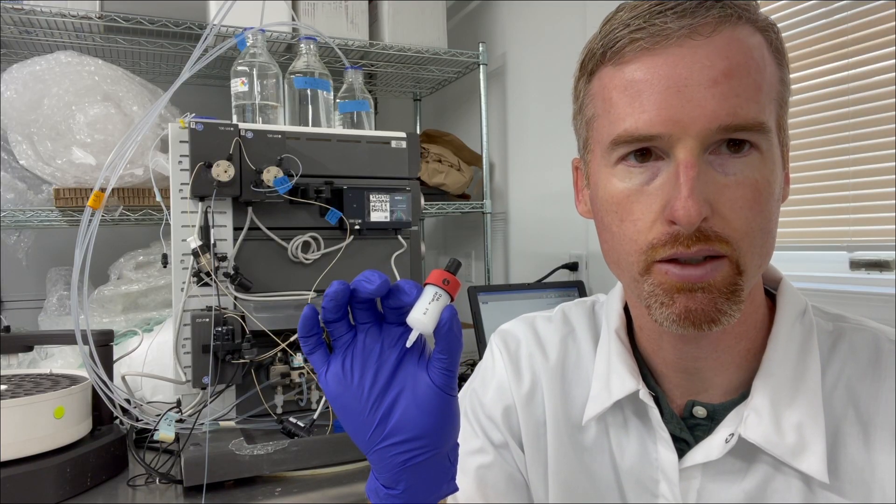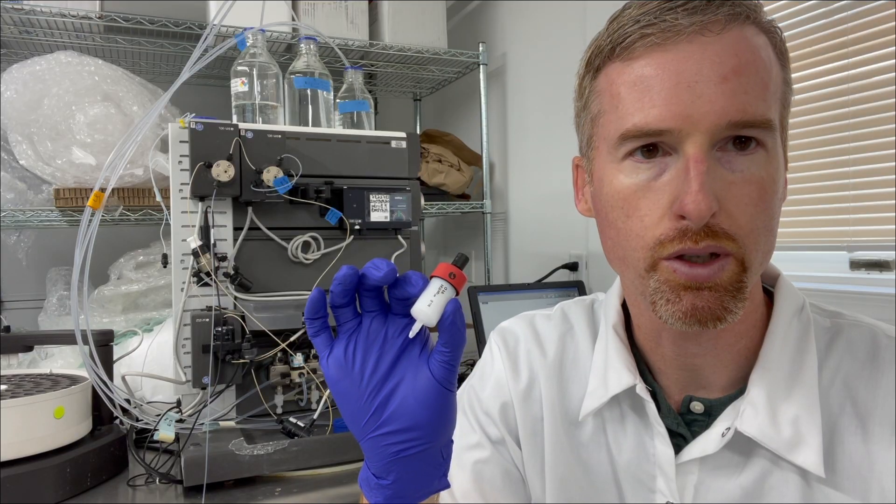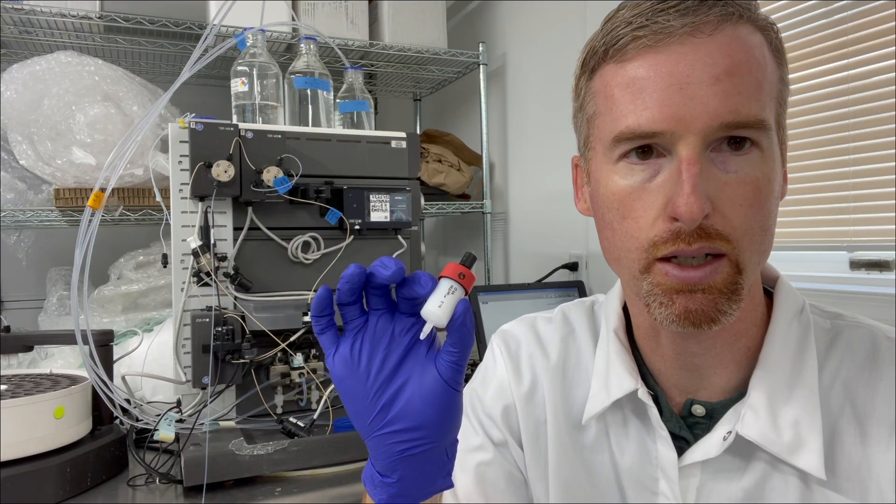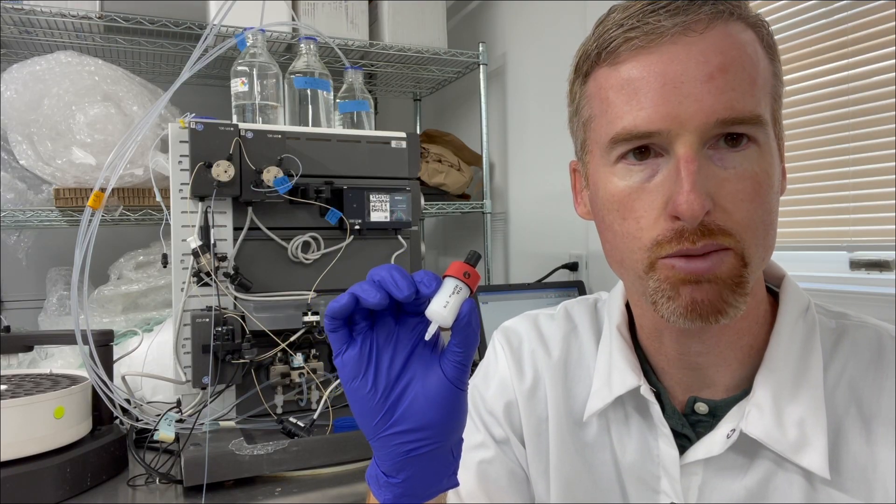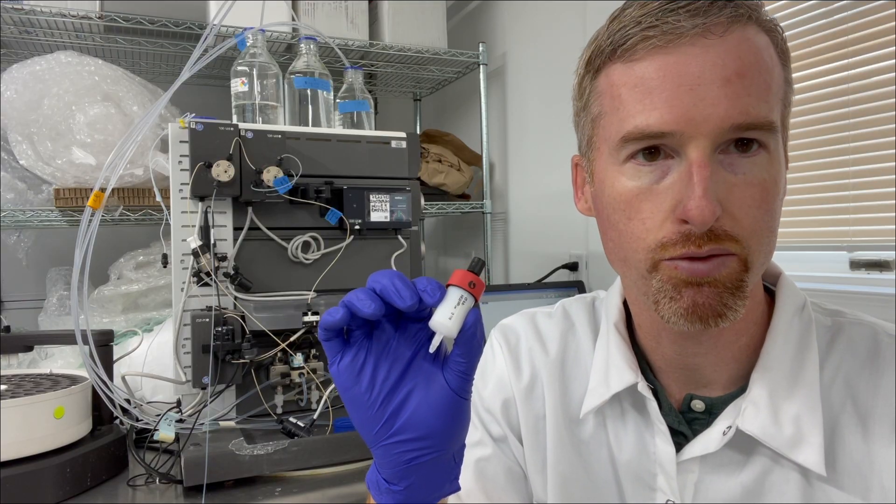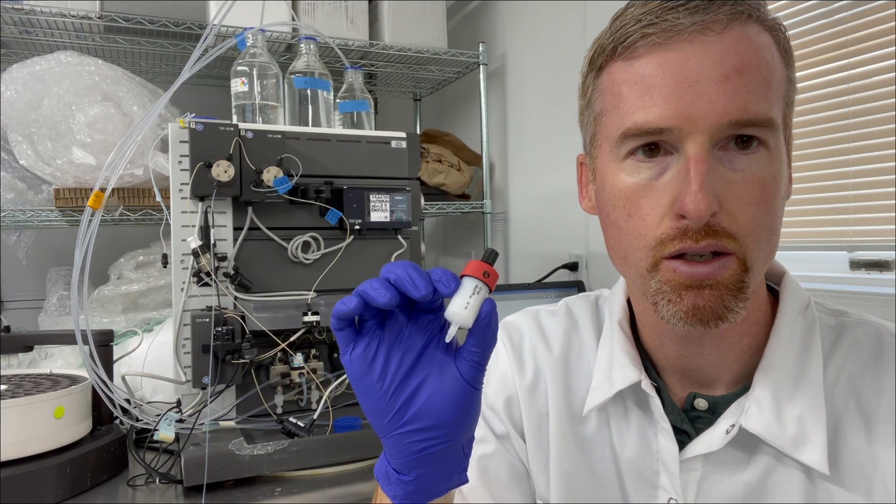It's made by Cytiva and I stored it with buffer B. That's the one that has 1.5 molar sodium chloride. I did that because I wanted to prevent bacteria from growing while I was storing it, but it's also going to prevent our protein from binding to this column.